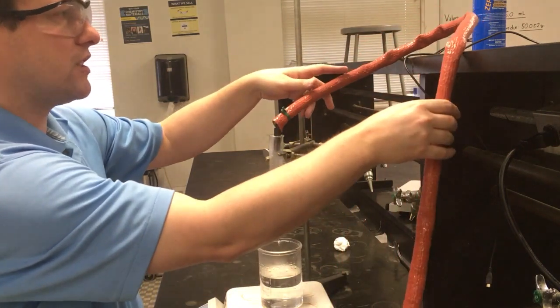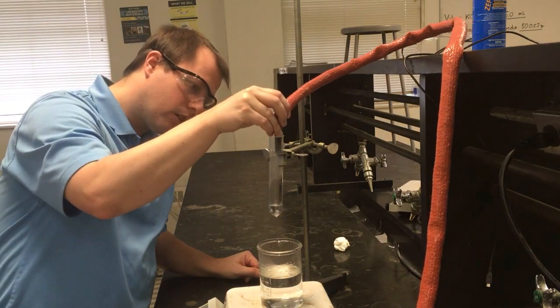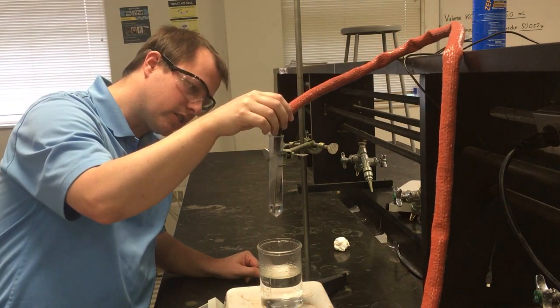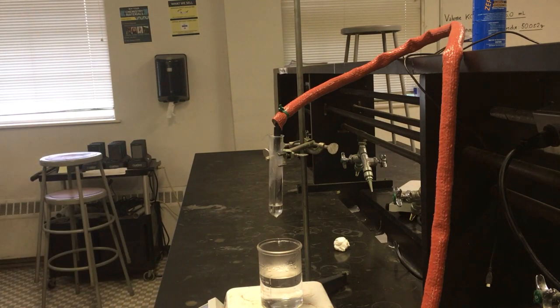I'm just adjusting some things so things will hopefully sit nice and stable. One last little stir here as things get going and start getting ready to cool down enough to solidify. But really it's now just a waiting game. So I'm just going to let this run for a little bit, and we're actually going to see it slowly cool down.